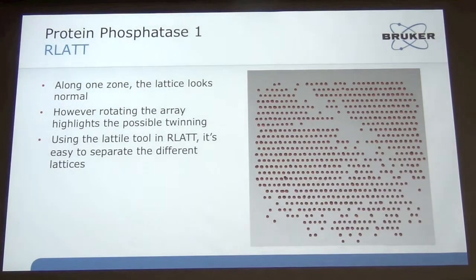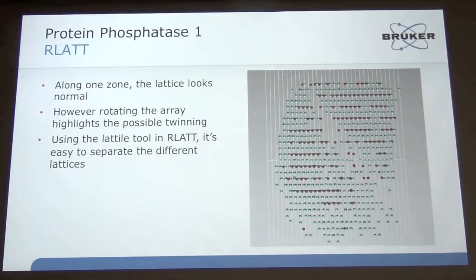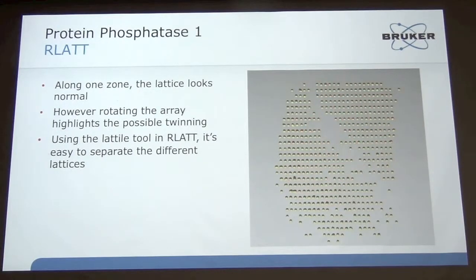So going into RLATT and looking in one direction, we see a zone, and everything looks fine. The spots look well separated, the lattices look great. Turn it 90 degrees, and you start to see something strange. You see that every other row, you have a single layer of spots. And then the other row, you have two spots that are very close together. And this is what we saw in the introduction, it's a partial merohedral twin. These spots are overlapping every other row, and then the rows between those are the individual spots in the individual domains. So in RLATT, I can just simply take one domain, highlight it, change it to a different color, and then take out the other domain. And now I essentially de-twin.